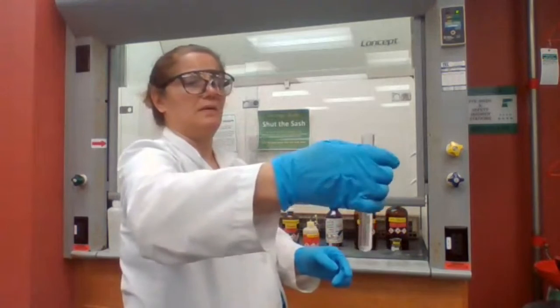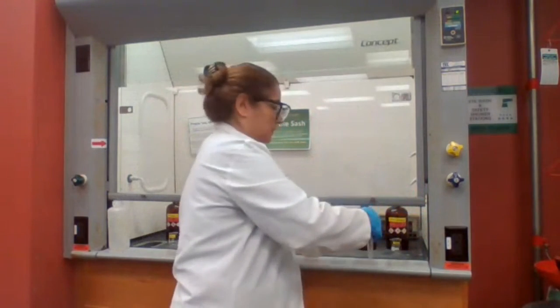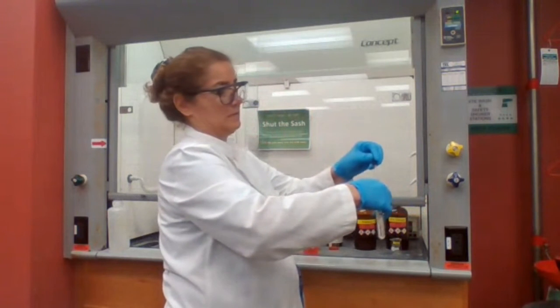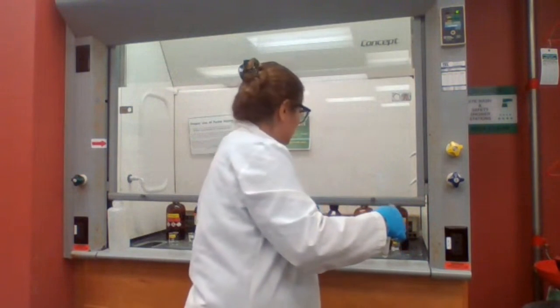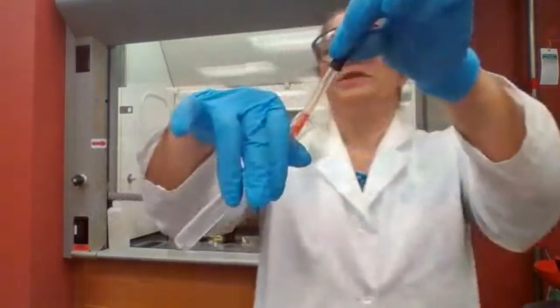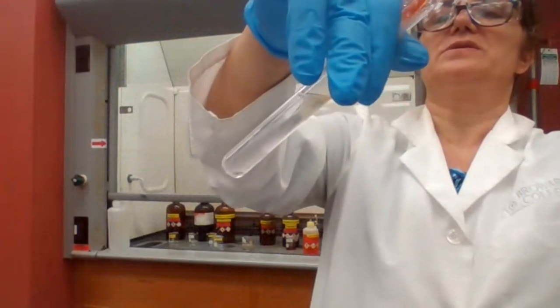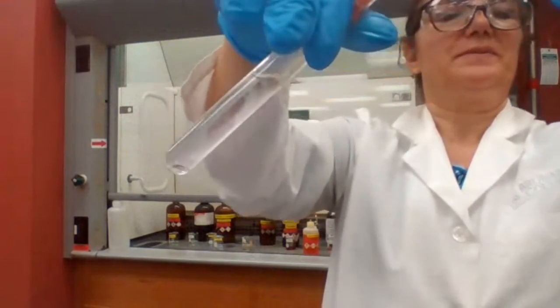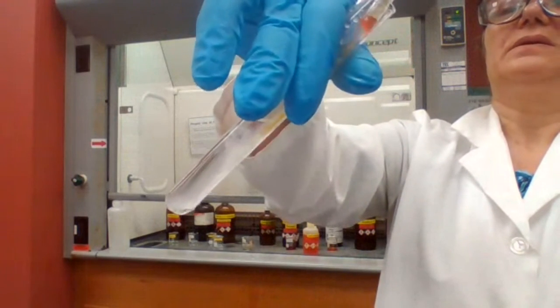Okay. The color of the bromine water disappeared. So we add, based on the procedure. See, when I'm adding the bromine water, right away it's still on top of the solution, that white precipitate that is forming. See that?